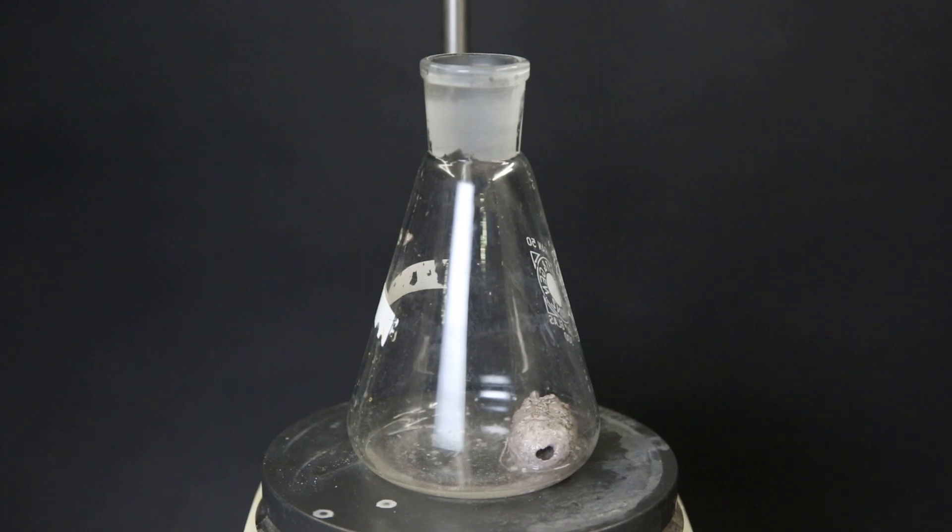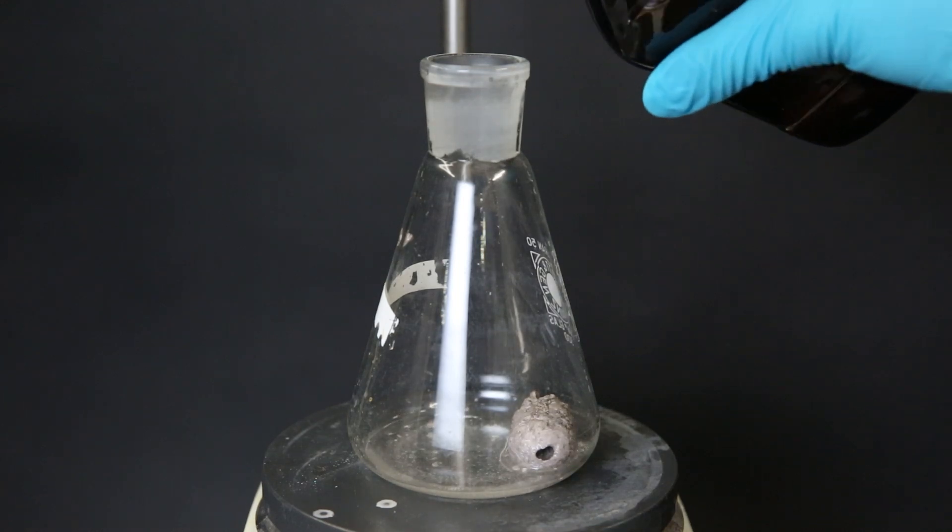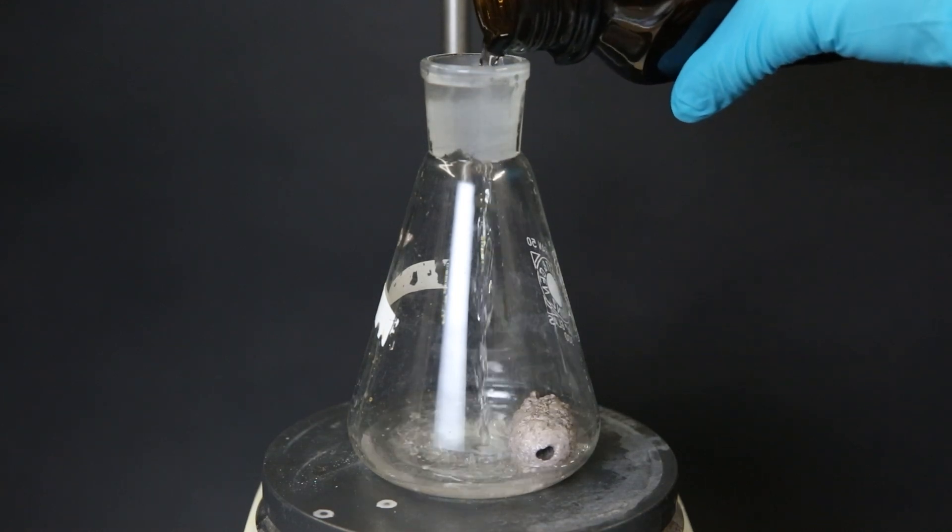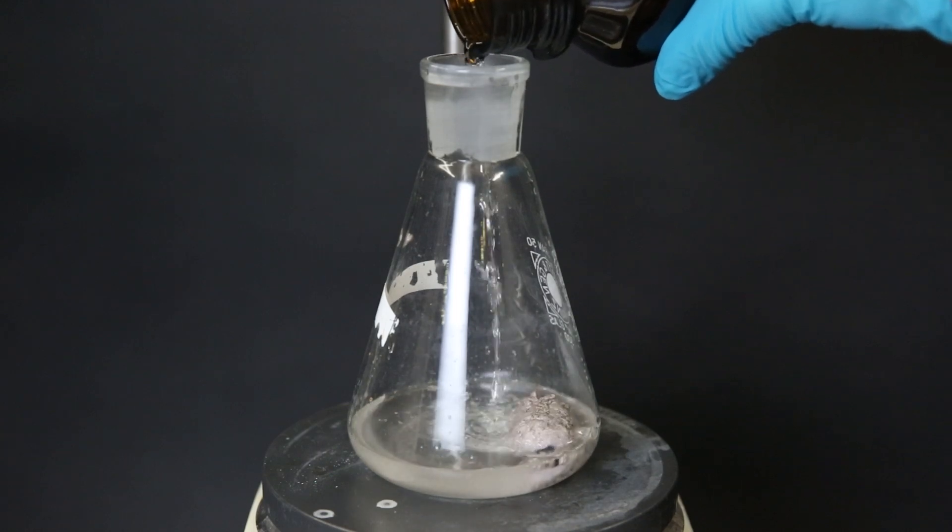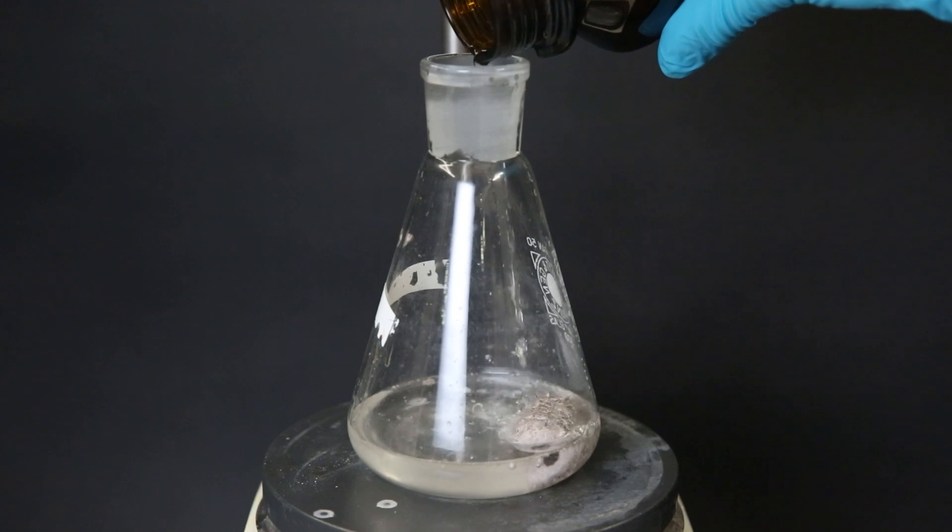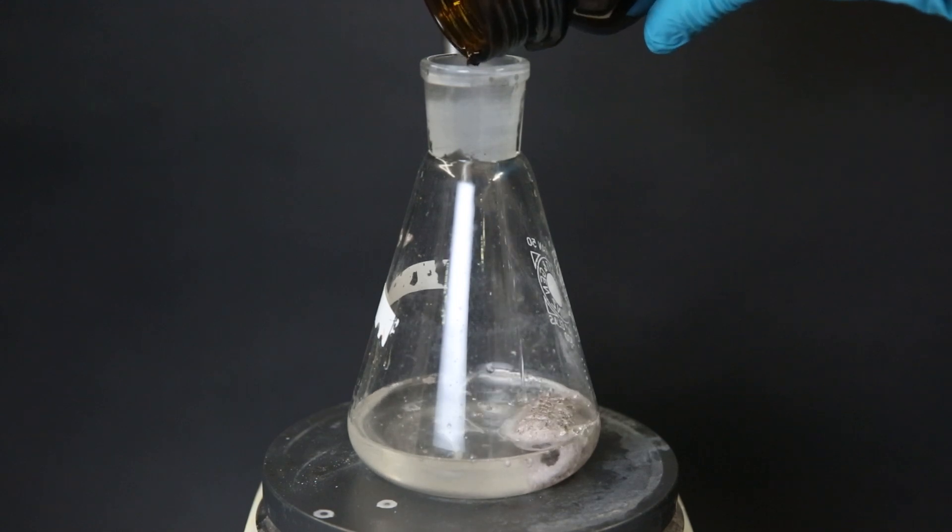This sodium is still very contaminated with bits of magnesium and I want to separate them. So I add in all of the 1,4-dioxane that I produced in my last video which was only 70 milliliters. Since I work with a limited amount of dioxane I tried to get rid of most of the paraffin oil beforehand but there were still some in there.